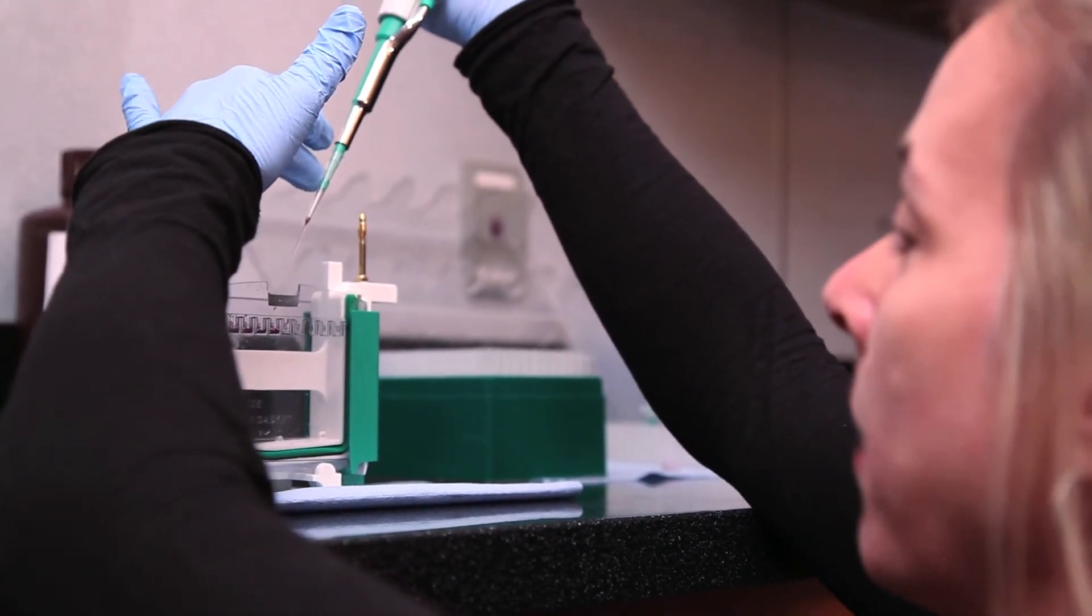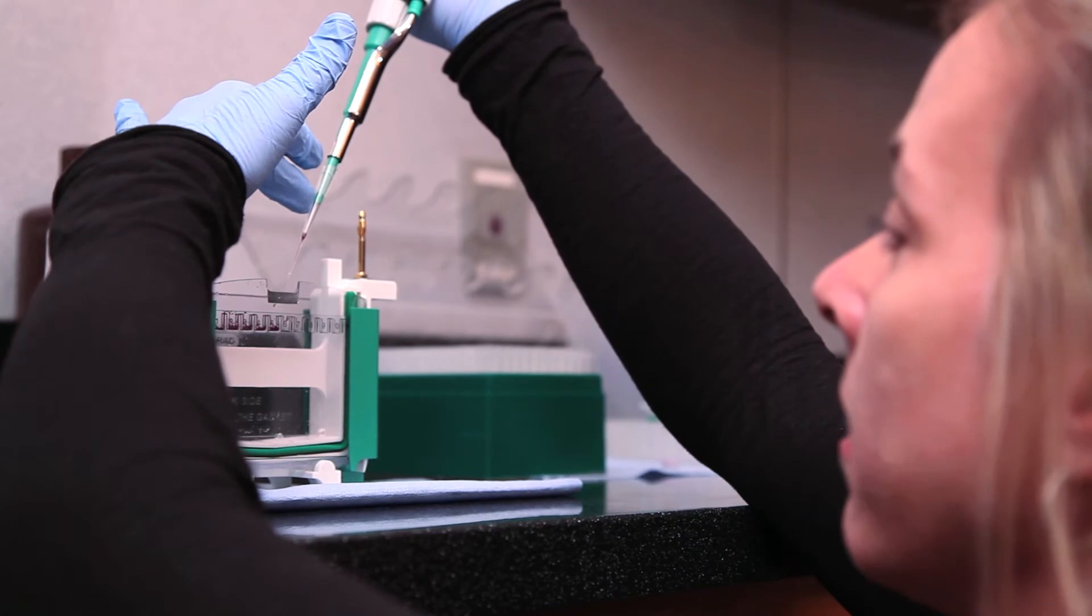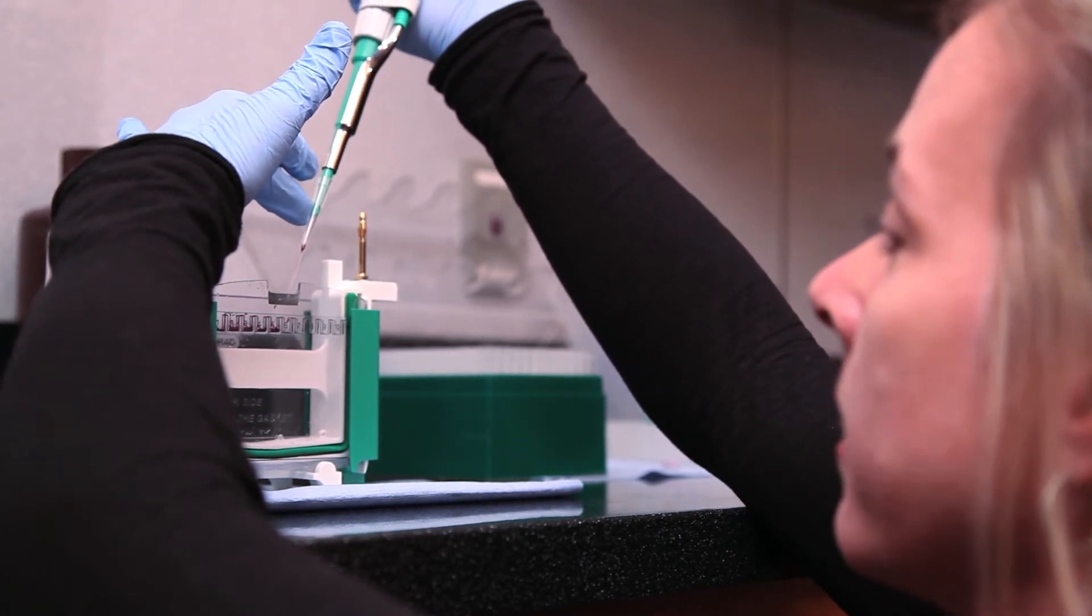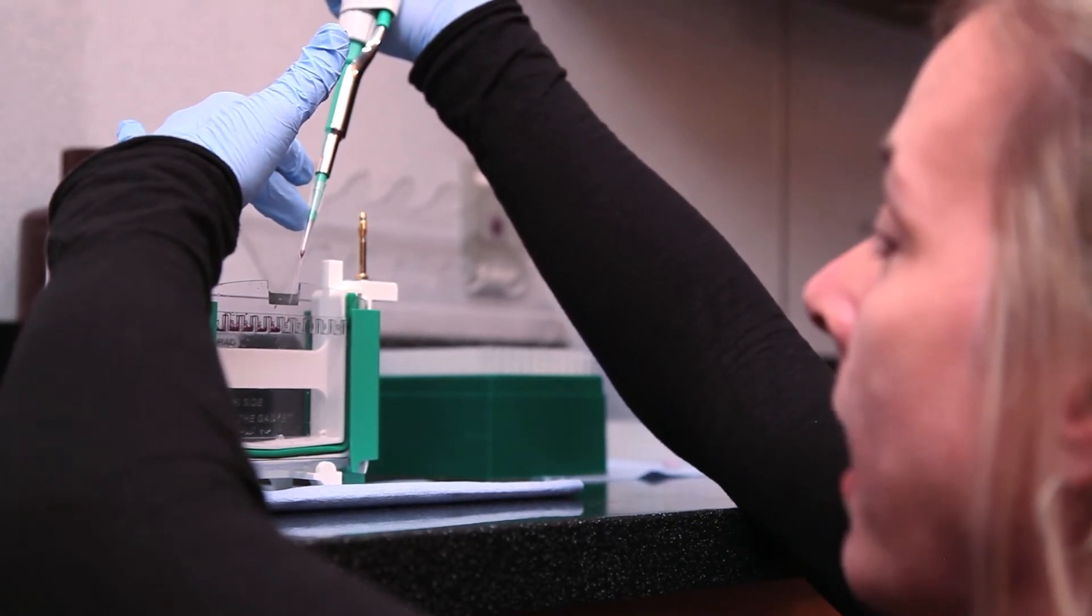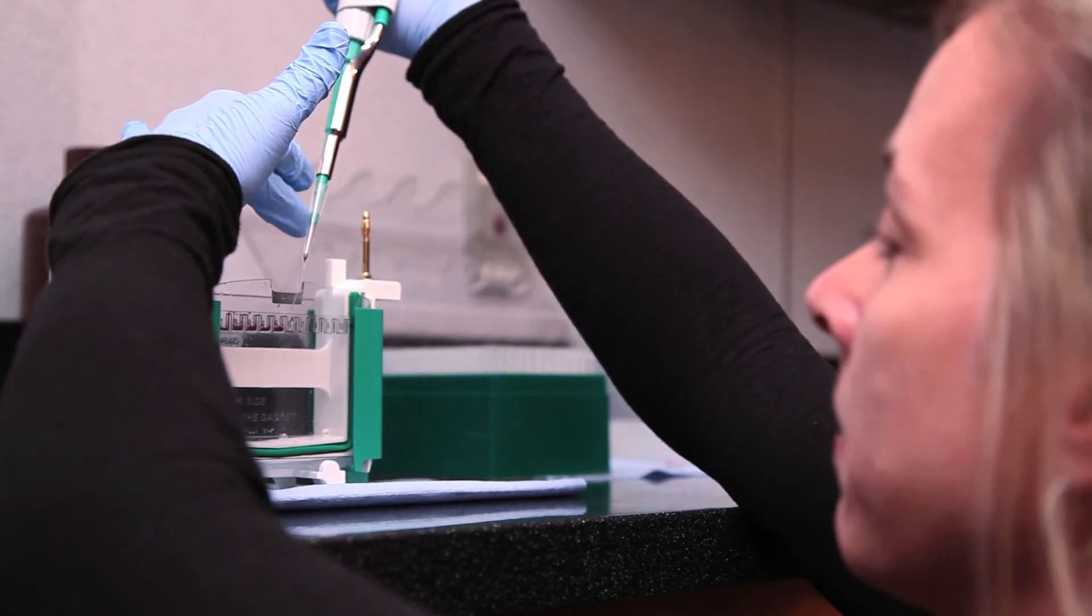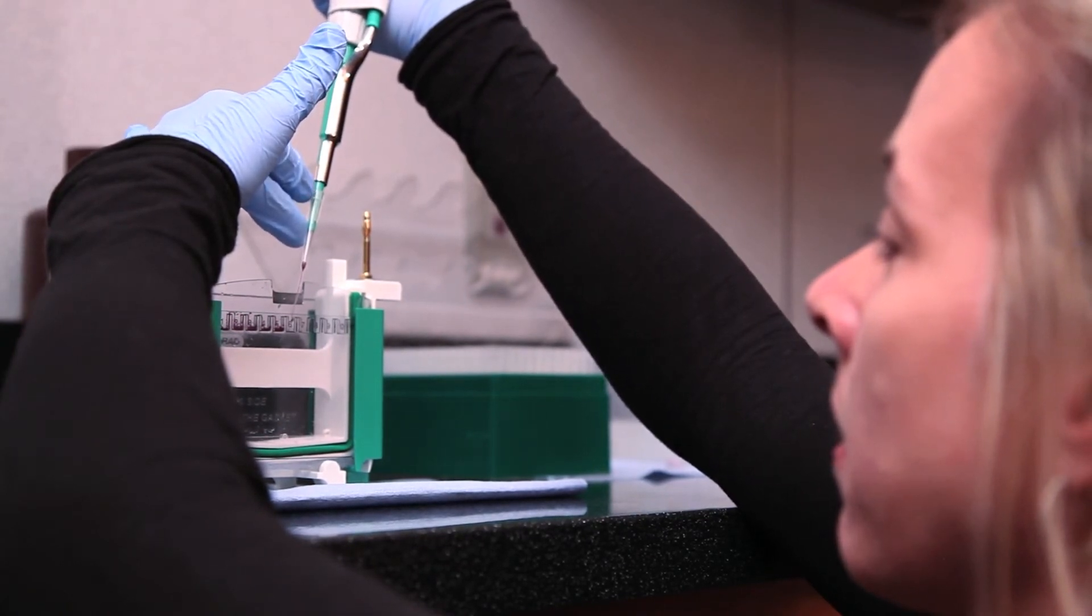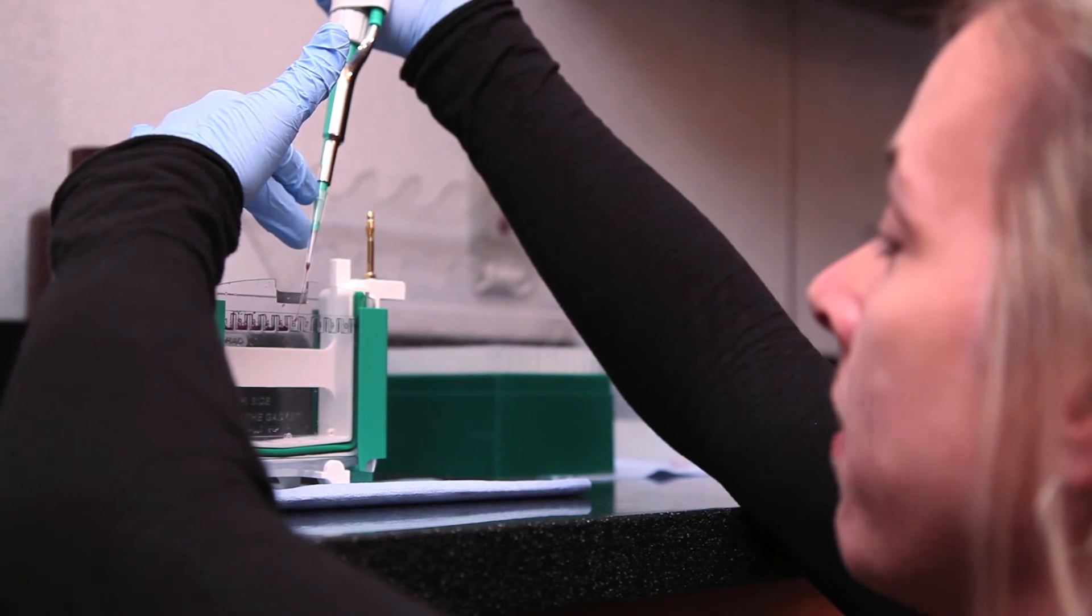And then I'm going to guide my pipette tip into the lane of the gel by pressing the tip against the back side of the front gel plate. I'm going to go into the center of the lane.